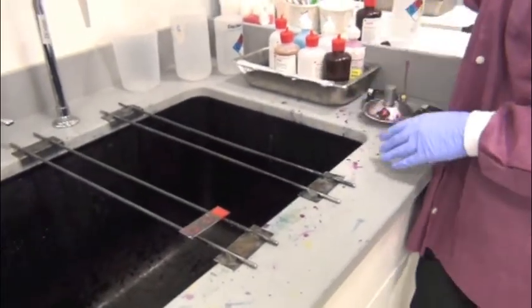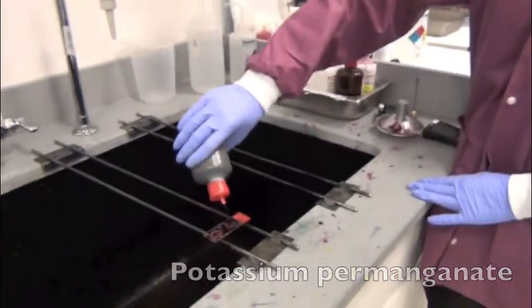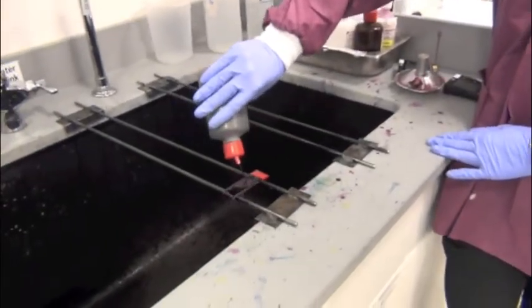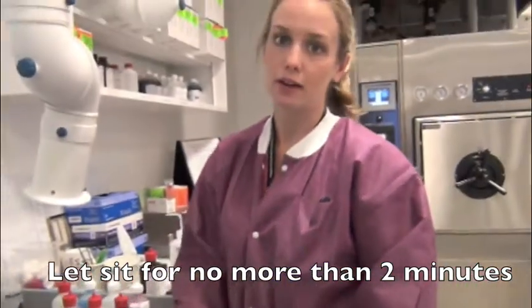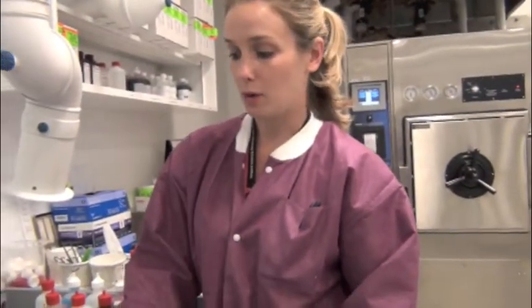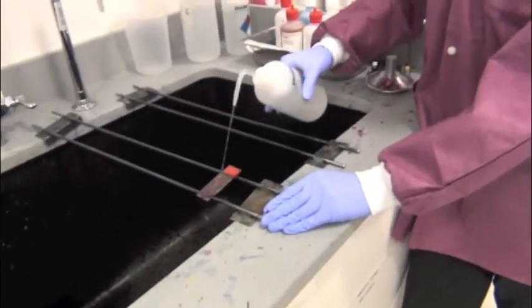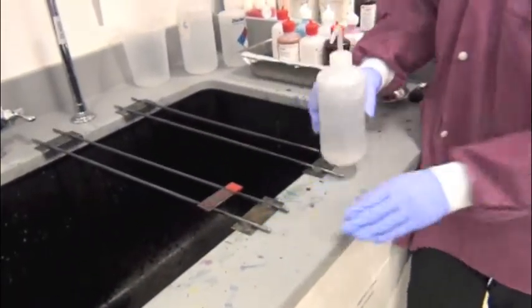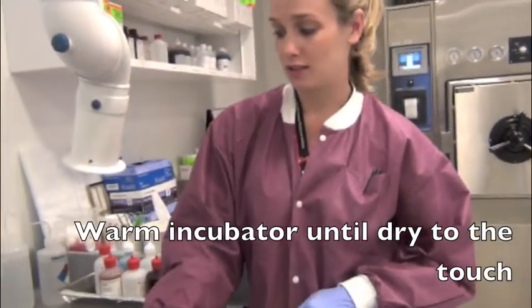The counterstain for our fluorescent slides is potassium permanganate. Potassium permanganate can stay on for up to 2 minutes, but no longer, in case we quench the fluorescence. We don't want to cover it up, so we don't want to counterstain for too long. Potassium permanganate can be rinsed off after 2 minutes. And similar to the Ziehl-Neelsen stain, we'll put it in the warm incubator until they are dry to the touch.